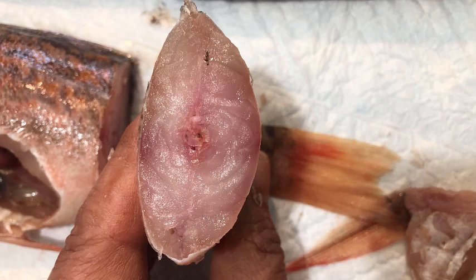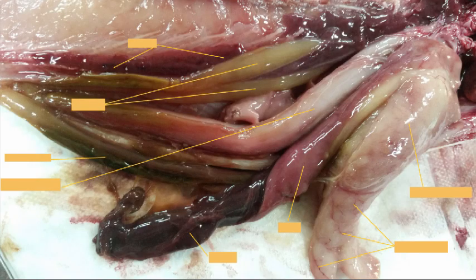That pretty much ends our virtual fish dissection in the coronavirus semester. Here's a little challenge for you though. In this image posted by a very industrious student from a past semester, the various parts of the fish anatomy are labeled. I'll reveal the identities of the fish parts — I'm not going to guarantee that they're correct — but I'll do so after scanning about, and I'm going to put a stop into the playback so if you want to rewind and have another look, you can do this as many times as you like. After the stop, the big reveal will occur. Enjoy.